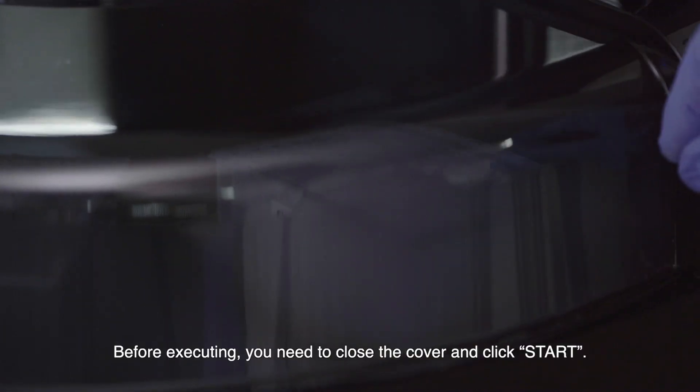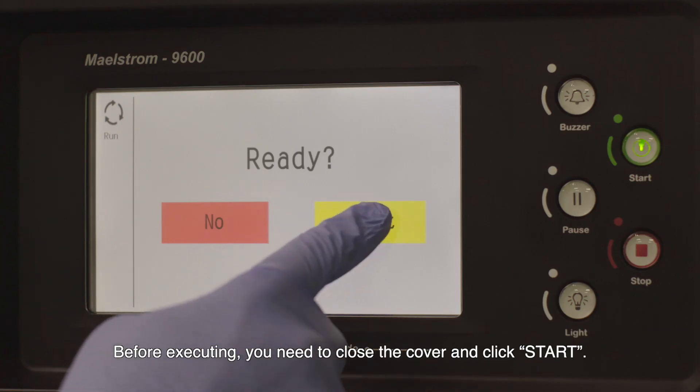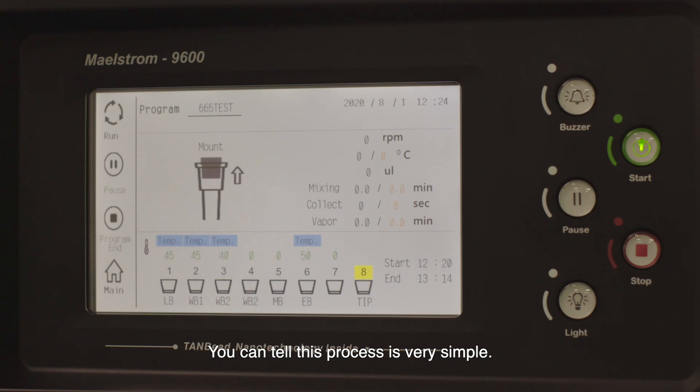Before executing, you need to close the cover and click start. You can tell this process is very simple.